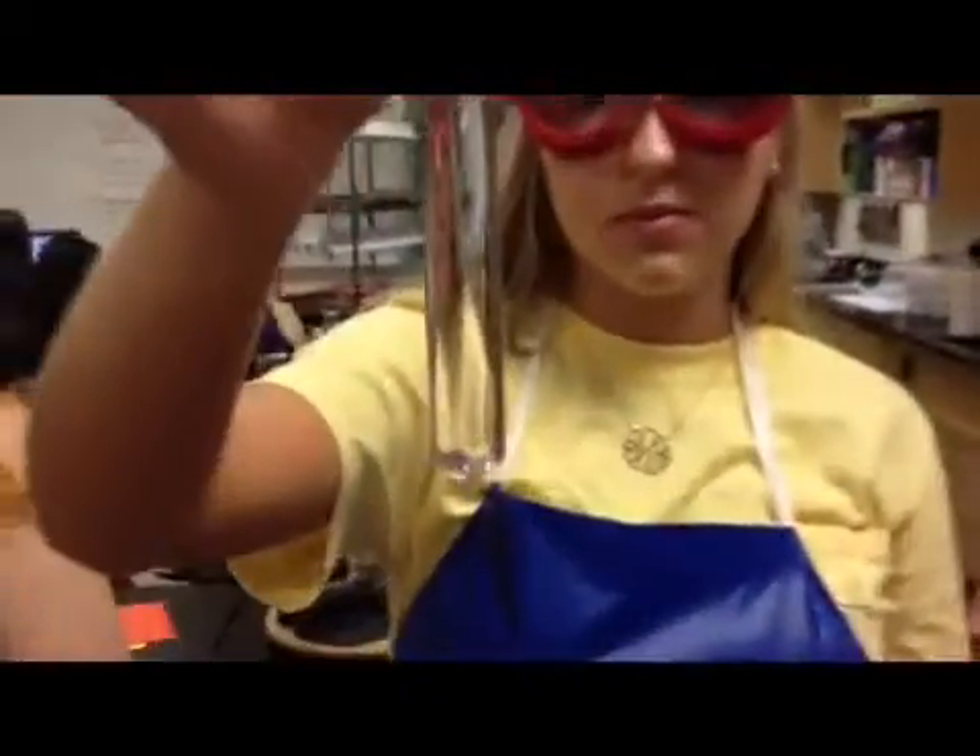And now we wait for two minutes. So it's been two minutes. This is the distilled water and it had no reaction because it's still the same color. You may not be able to see it, but this is a slight purple color — this is the protein solution, which shows that it had a reaction to the Biuret reagent.